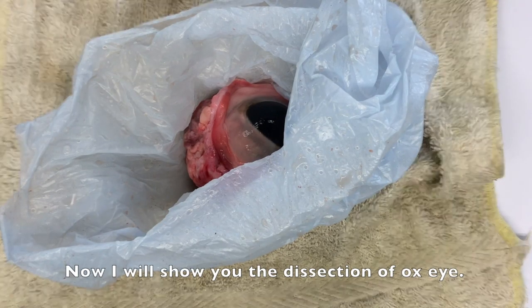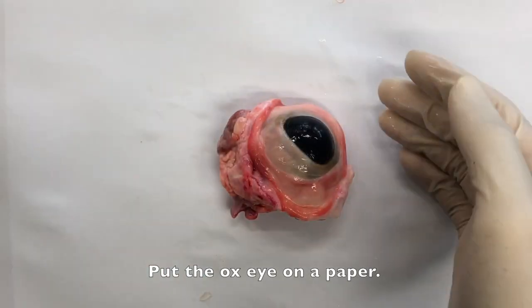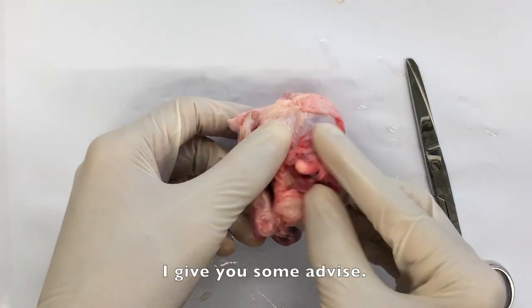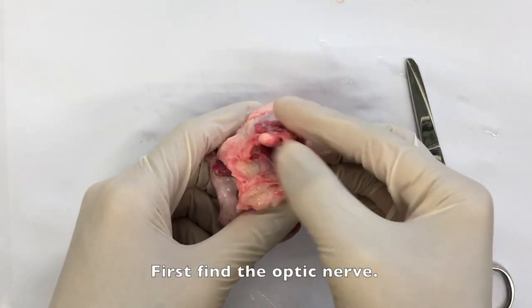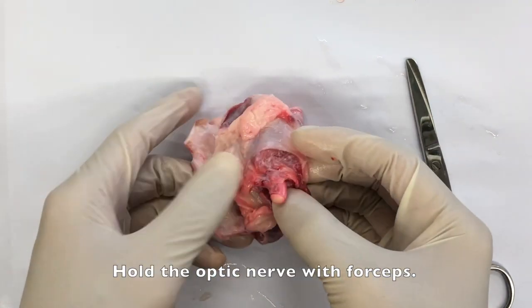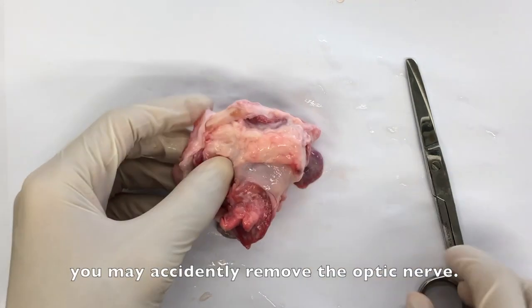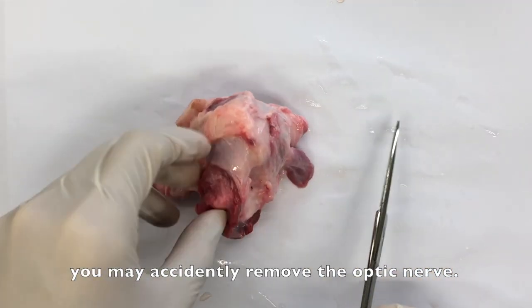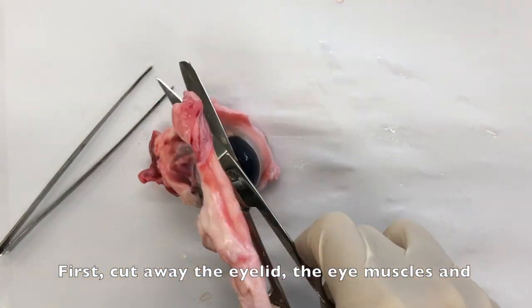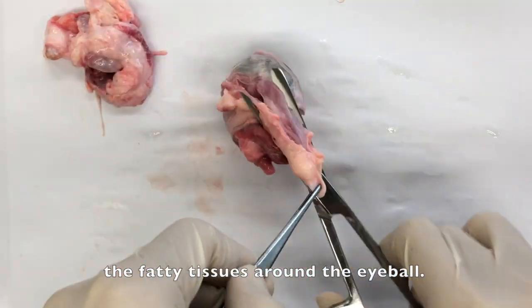And here I will show you the dissection of an ox eye. First of all, I put an ox eye on a white paper. I give you some advice: first find the optic nerve and hold it with forceps. That is because when you cut away the eyelid and the fatty tissues, you may accidentally cut away the optic nerve. First of all, we cut away the eyelid, the eye muscles and the fatty tissues around the eyeball.